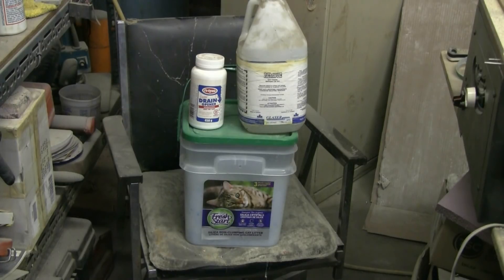On the left I have a smaller bottle of lye crystals sold as a drain opener. On the right I was able to get sodium hydroxide or lye in concentrated liquid form — it's almost as thick as a syrup. I got this from a barbecue store; it's used for removing grease and carbon from barbecue grills and other barbecue parts.